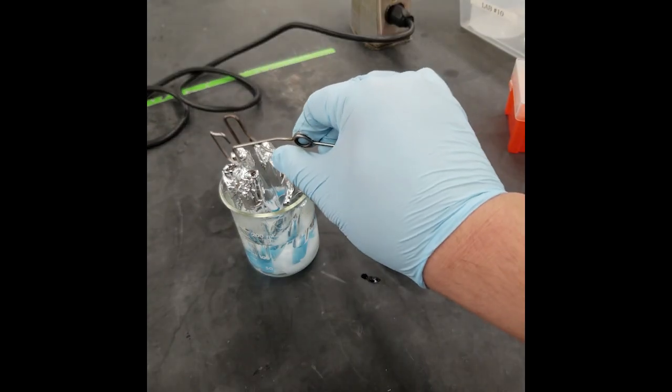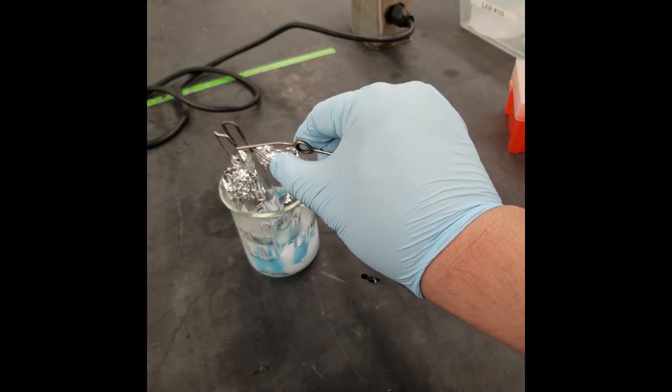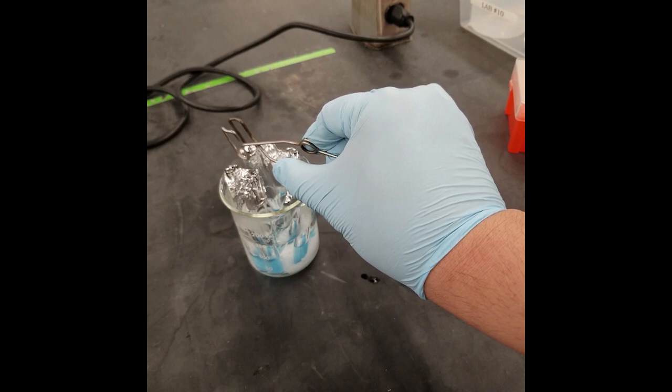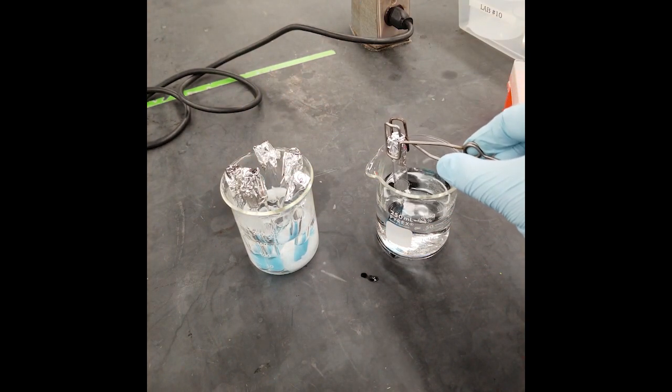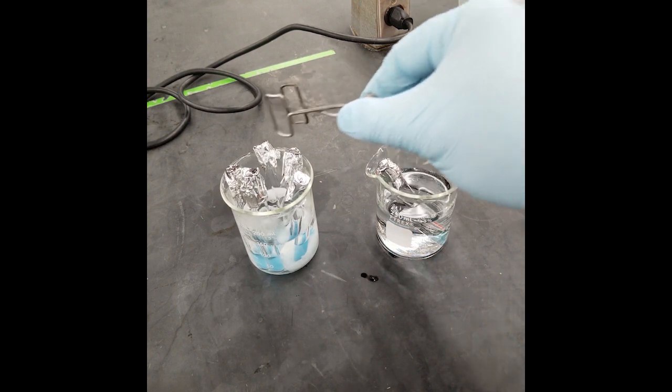Take another beaker or two and fill them up halfway with warm water from the tap, and using the small tongs, transfer your assay tubes to the warm water in the same order that they were placed into the boiling beaker.